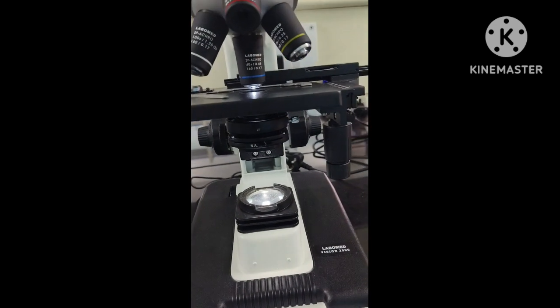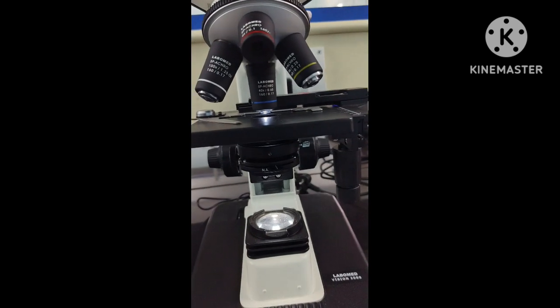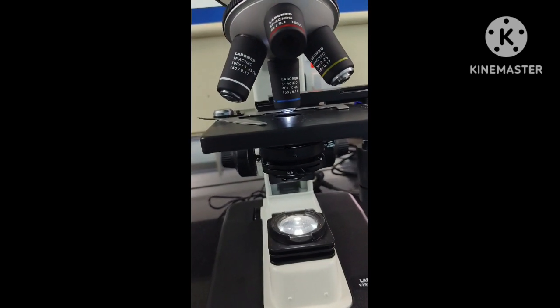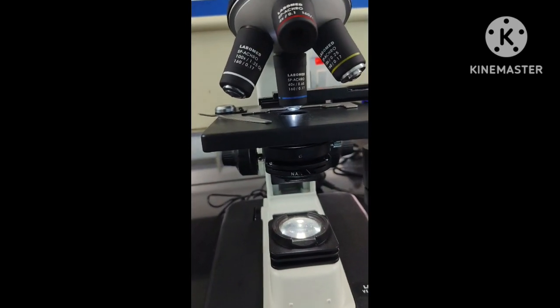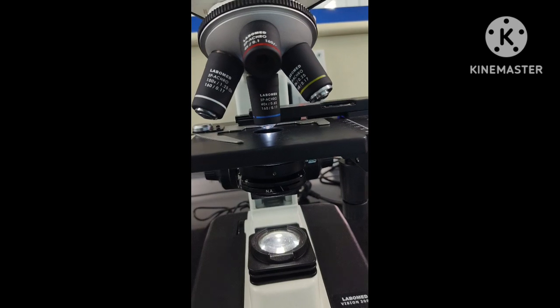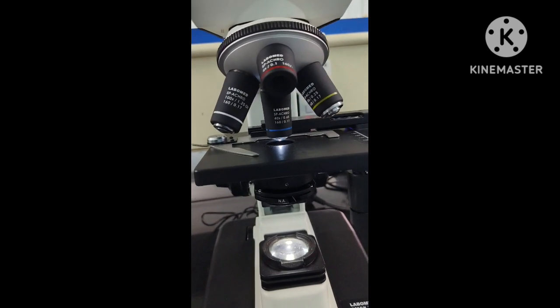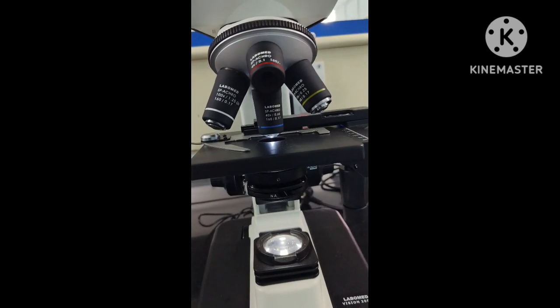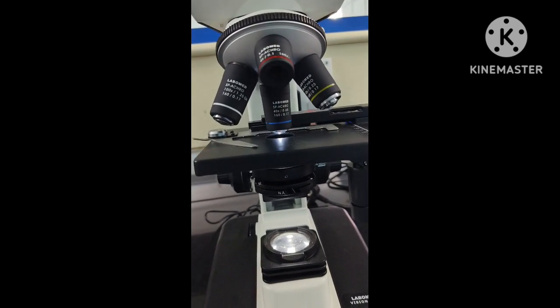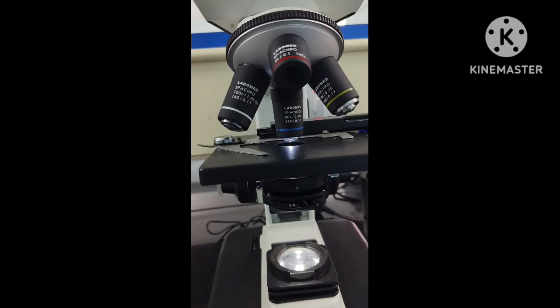So this is how you adjust the illumination of a microscope. These adjustments are the classic adjustments which are already worked out, and we are giving them to you as pre-prepared. In the examination, if you are not answering any of the other questions that the examiner is asking, he will finally ask you something about the microscope, and that would mostly be about the light adjustments. If you are not able to answer these basic questions, you will be in deep trouble.